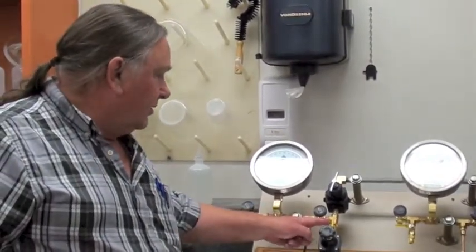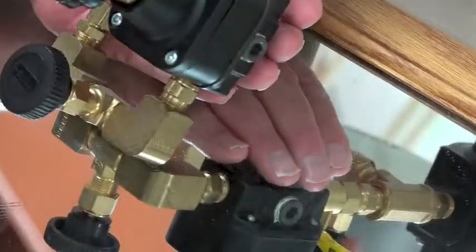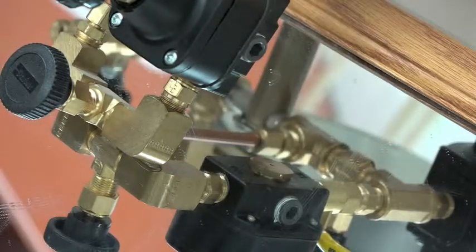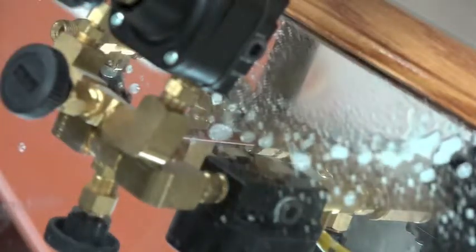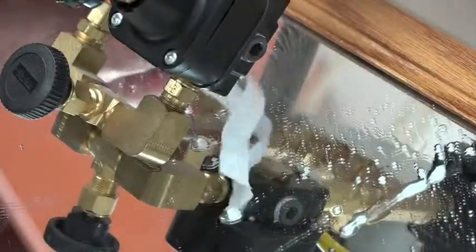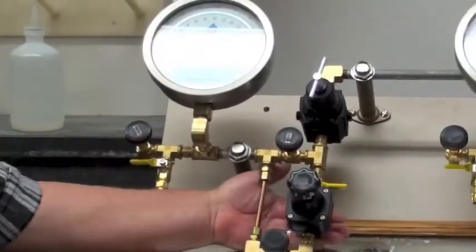If you turn that off but leave this open, you can actually hear it. That's off, but that's open. Try to put soap back here. You've got wild air, a very large amount of air, high pressure.